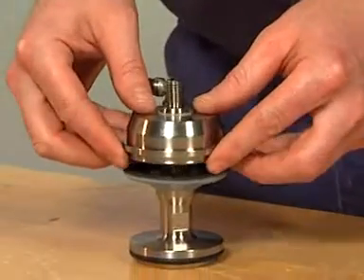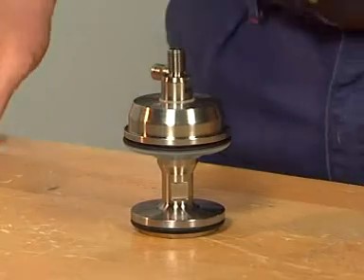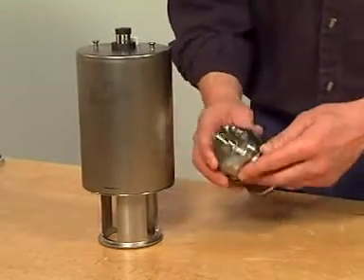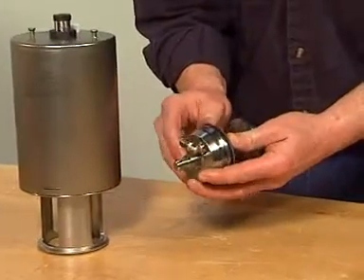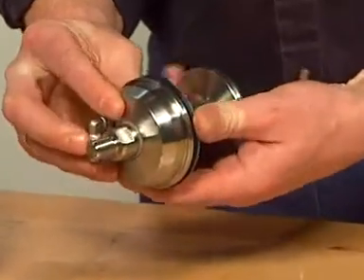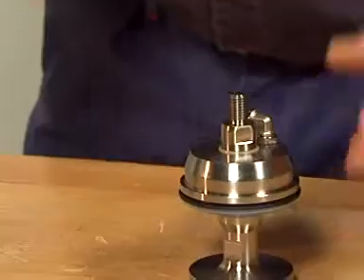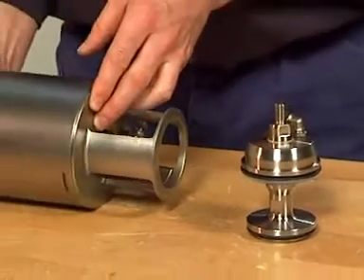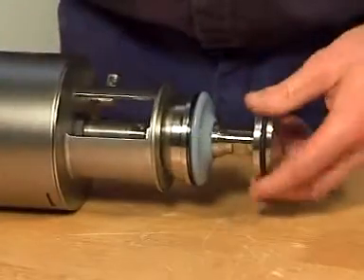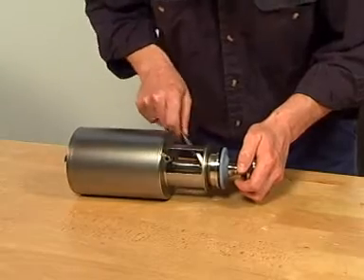Place the bonnet on the aseptic valve plug and connect the bonnet to the diaphragm. Remember to ensure that the diaphragm is properly connected to the bonnet. Connect the plug assembly with the actuator and tighten, being careful to ensure that the diaphragm mounts properly. Use two size 17 spanners to tighten firmly.